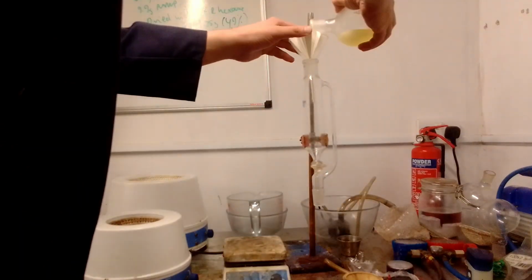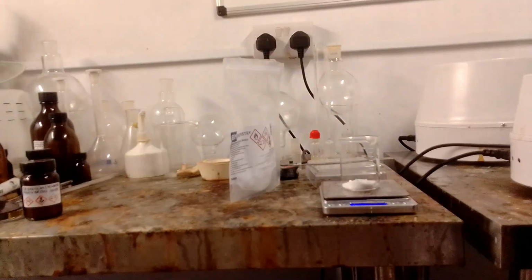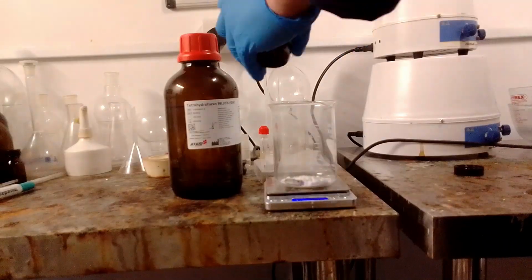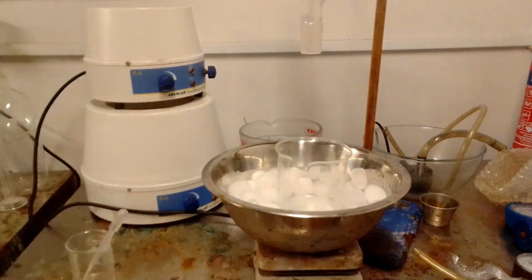The PCE solution of acid chloride, which had been cooled in the fridge and contained some solid salicylic acid, was filtered by gravity into an addition funnel. While filtration was taking place, sodium borohydride was dissolved in DMF. Once it was dissolved, cadmium chloride was suspended in THF, the beaker containing the suspension was placed in an ice bath, and the borohydride solution was added to it, causing some effervescence.